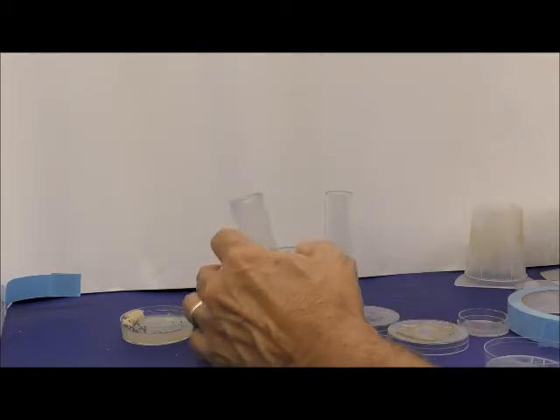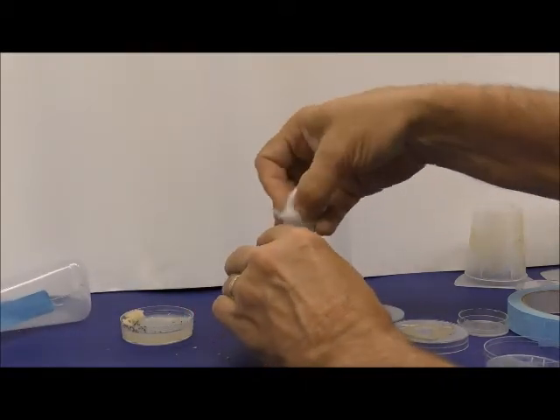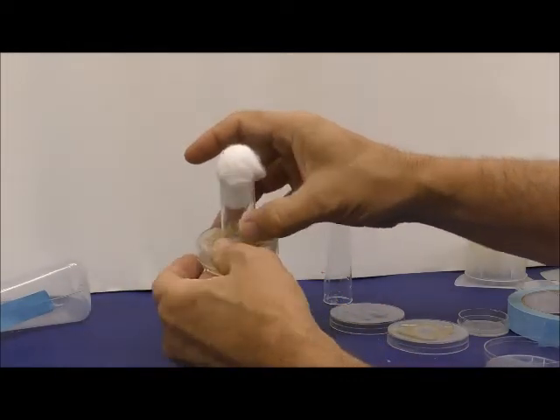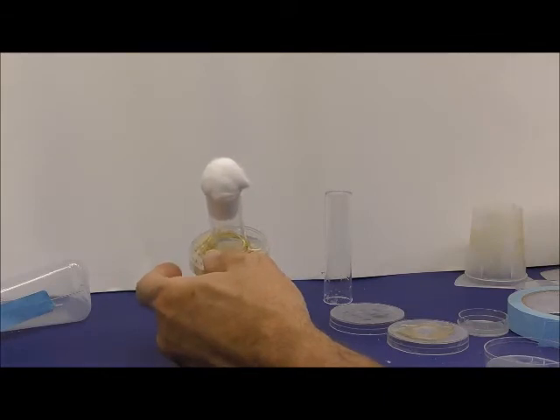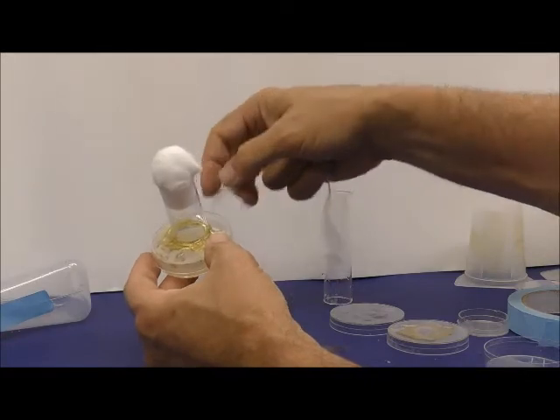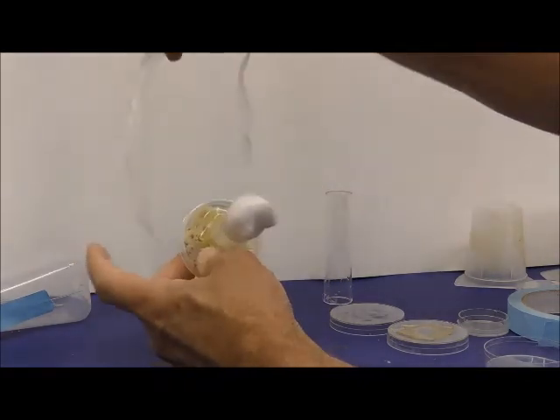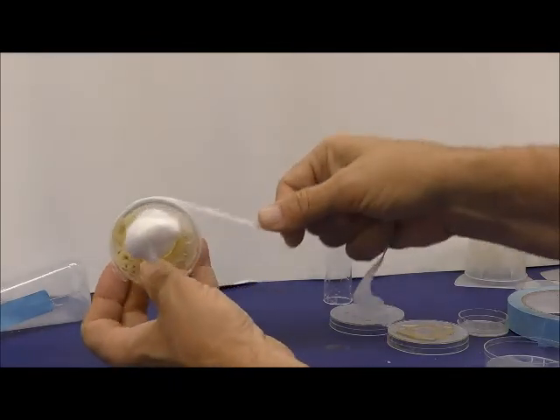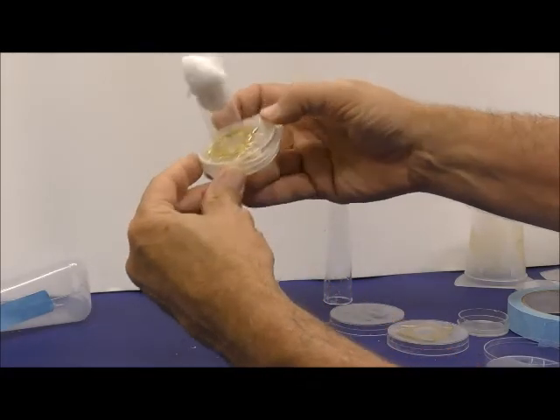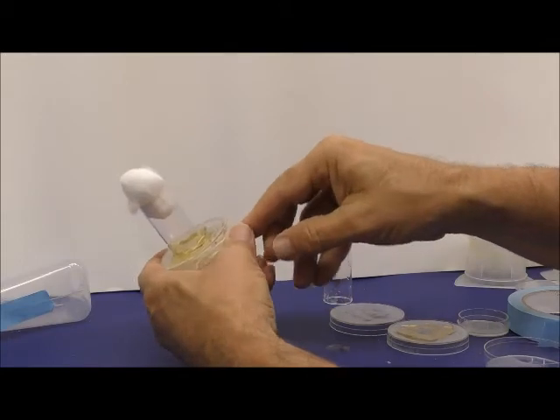Now you have an epoxy glued vial that's on there. What's easy to do with this now is to take cotton, put cotton in here, and you can collect your egg pulse relatively easy this way. But do remember, if you're going to put adults in here, they will come up and come out of this little dish. So you really need to put saran wrap or parafilm around the edge so the adults cannot get out. So if you want to do an egg pulse like this, this is one way.